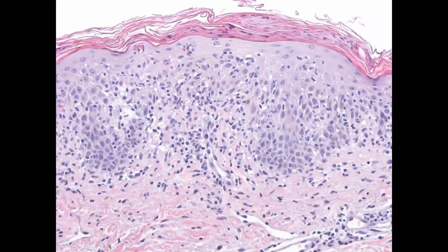And then here, which is another diagnosis we're going to talk about in the lichenoid category. But psoriasiform, it's kind of weak here, but you have epidermal hyperplasia, you have a little bit of spongiosis, and you have lichenoid inflammation causing necrotic keratinocytes and a dirty scale. This is pityriasis lichenoides, a little bit psoriasiform and a little bit lichenoid. Okay, but we'll cover that more in the next section.